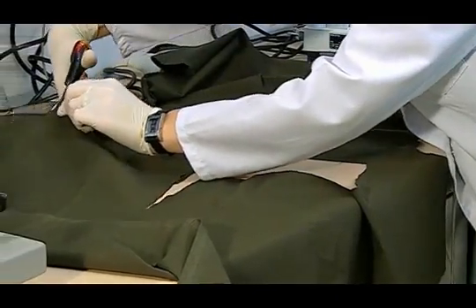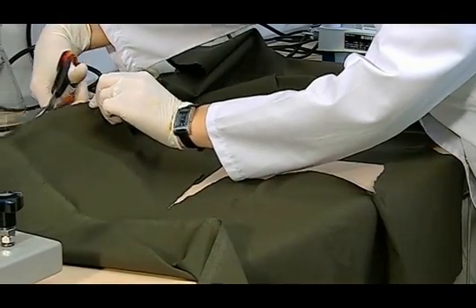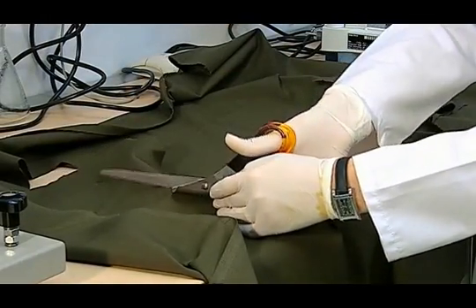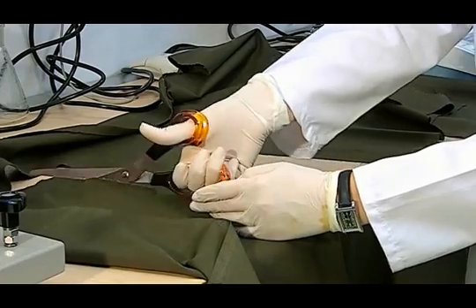In addition, it is very important that our samples are conditioned in standard atmospheric conditions before being subjected to the test.